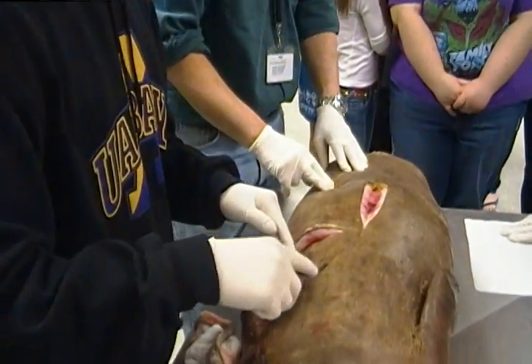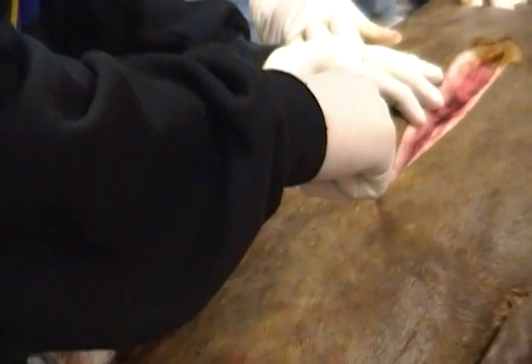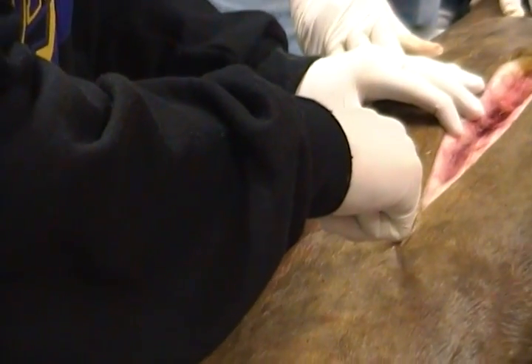Come on, Matt Derrick, do you want me to go to Matt? Yep. Gently, Matt. Don't cut the pulmonary arteries. That's a little too hard. You can always go back and do it again. Nice. That's good.